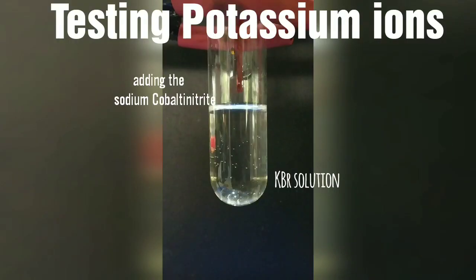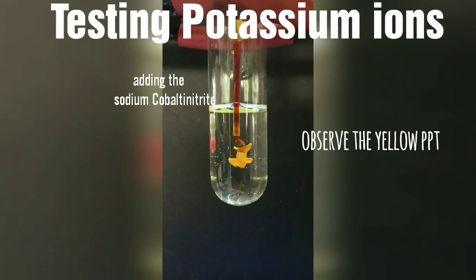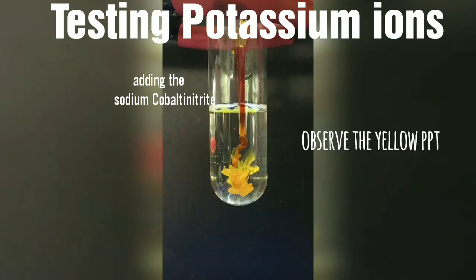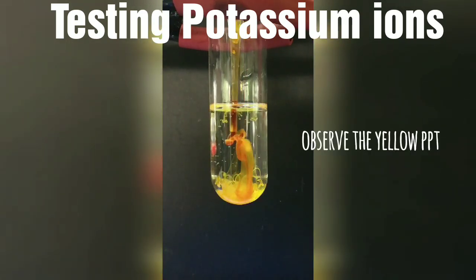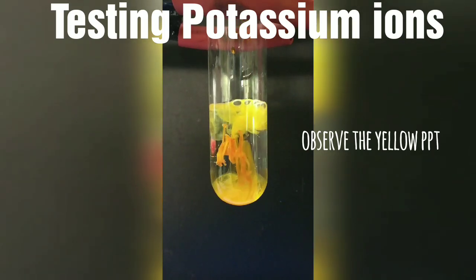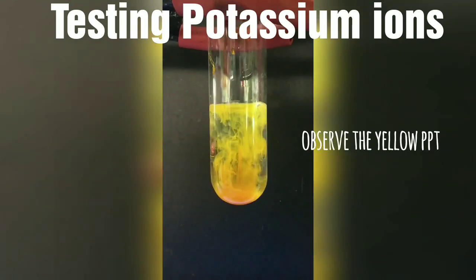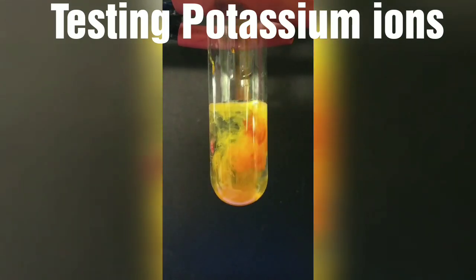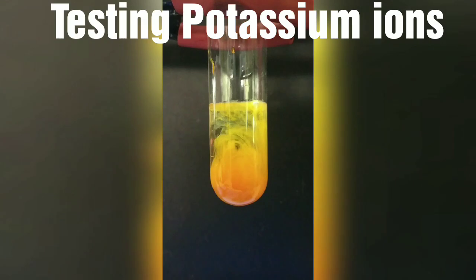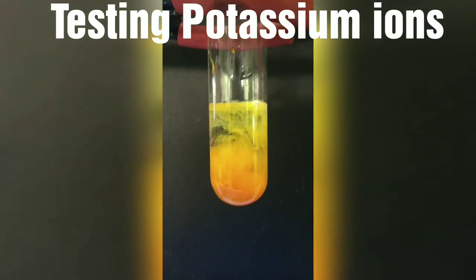We will now test for potassium ions. Here I have taken potassium bromide solution. On adding the sodium cobaltinitrite solution, you can see the formation of a beautiful yellow precipitate, which confirms the presence of potassium ions.